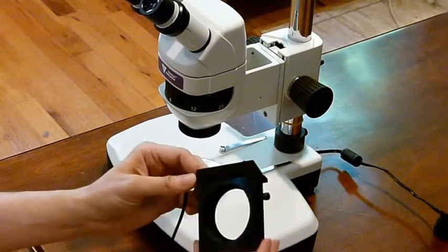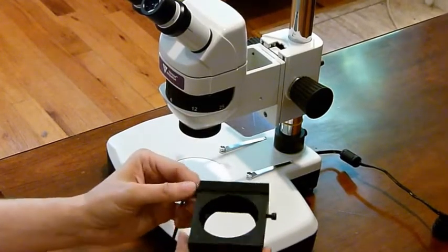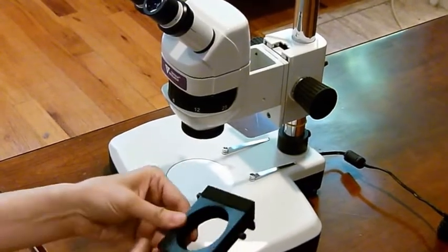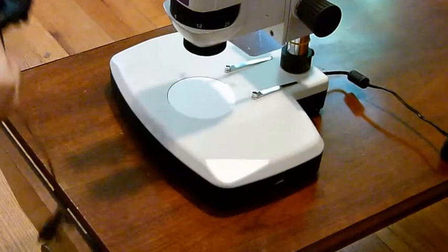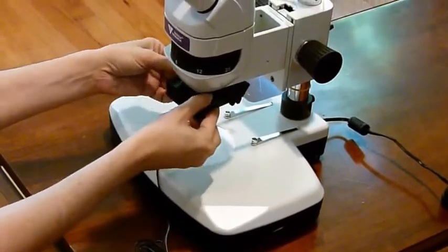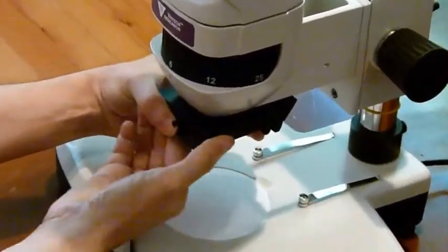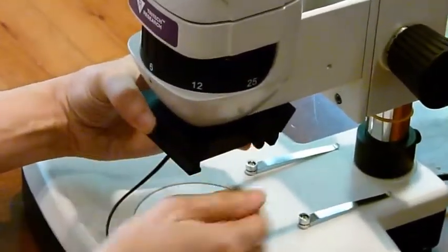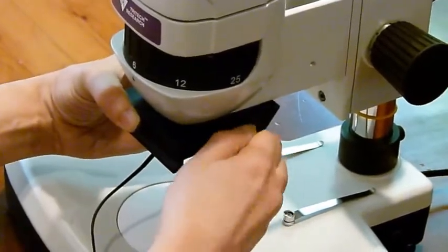I'm going to show you how to put the slider bracket on the microscope. It has this set screw right here. It just slides right over the objective lens like that. Get it nice and straight, and you tighten the screw.